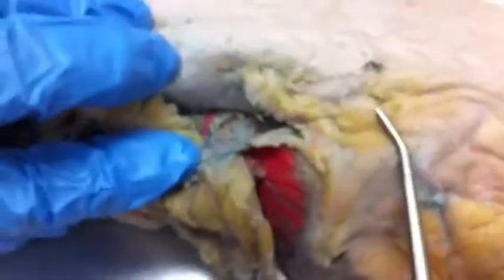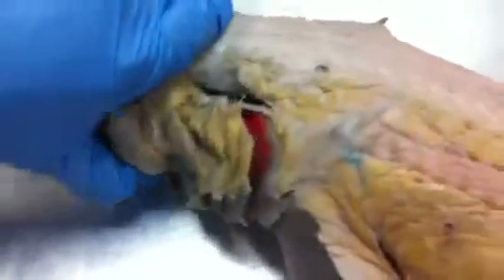That you just tore. Yeah. So, obviously we're not going to have our shark, but hopefully we'll be able to recognize this on something else. Okay, so that sums up the shark part.